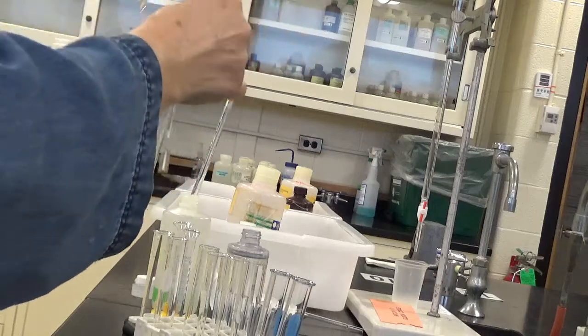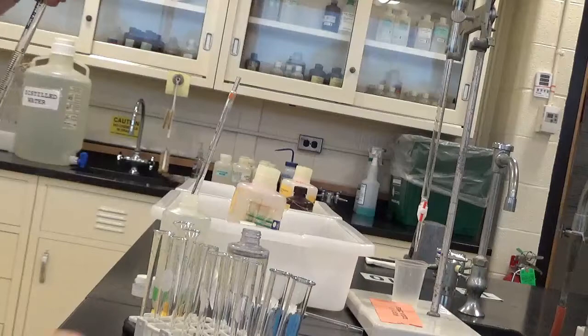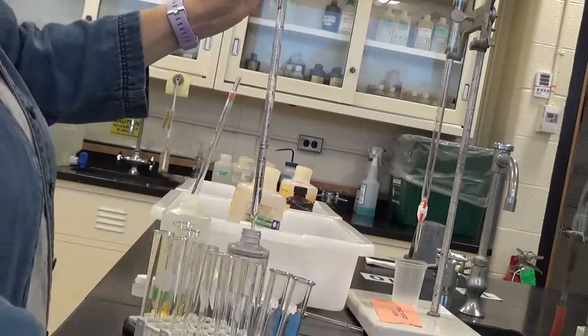Three in the next one. I don't have enough for 4, so I'm going to fill it up again.